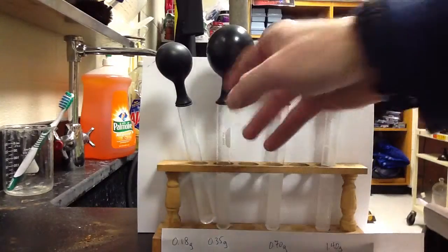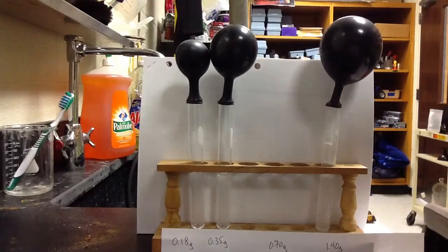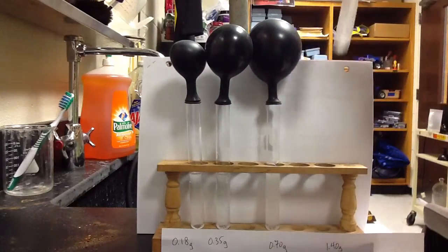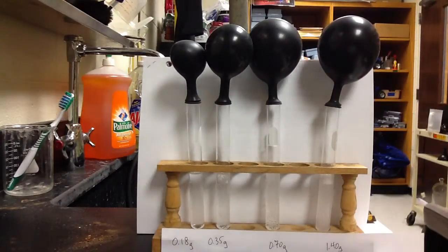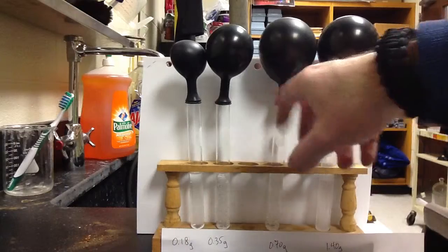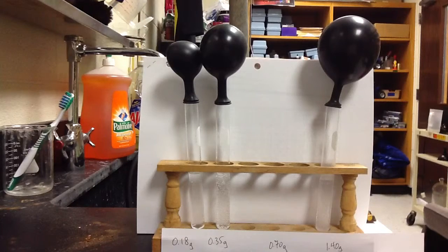This is a neat lab because normally one of the reasons that reactions like this can be tough, and why the law of conservation of matter is hard to prove, is that gases tend to escape when things change form. You have a chemical reaction, and if you produce a gas, the gas is usually hard to capture. So we're capturing our products as a gas and using that to help figure out what the limiting and excess reactants would be. Everything is pretty much reacted as far as I can tell here.